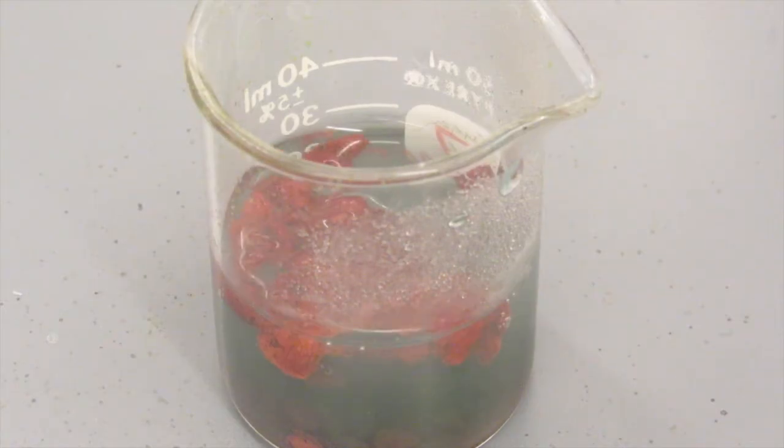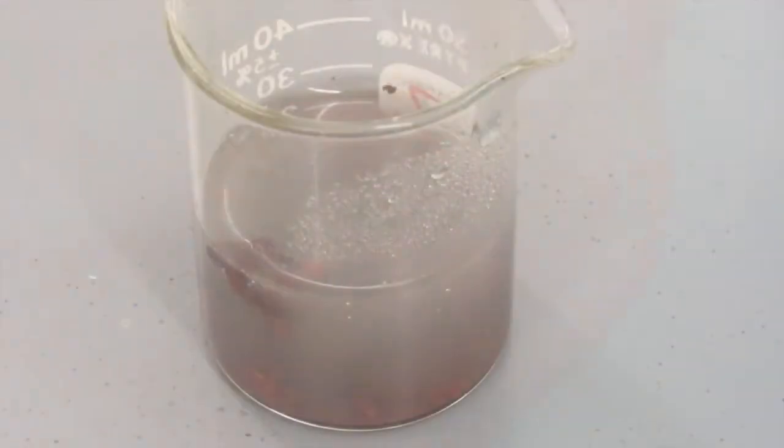You can see the copper growing on the aluminum foil that was suspended in the solution. As you stir it, a lot of the copper starts to sink to the bottom.